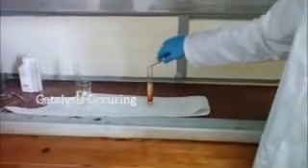As the hydrogen peroxide comes in contact with potassium iodide, they react, and oxygen and water are released. This water combines with the detergent to make bubbles and is expanded rapidly by the formation of oxygen gas, pushing the bubbles apart and increasing their volume to expand the foam.